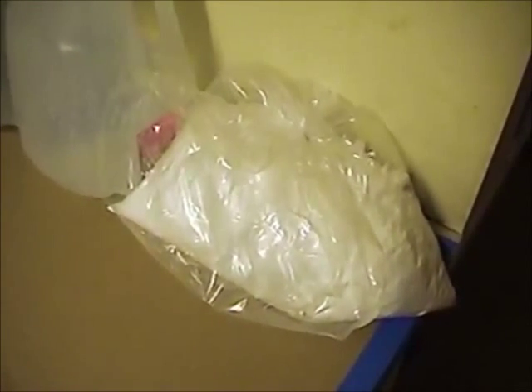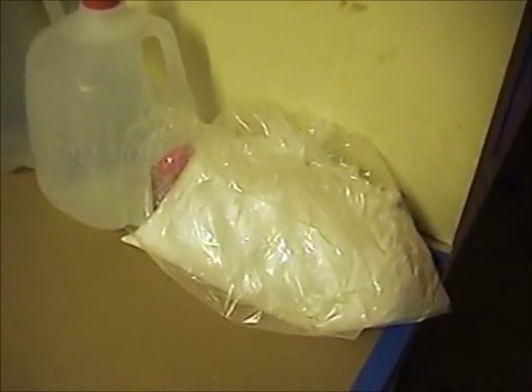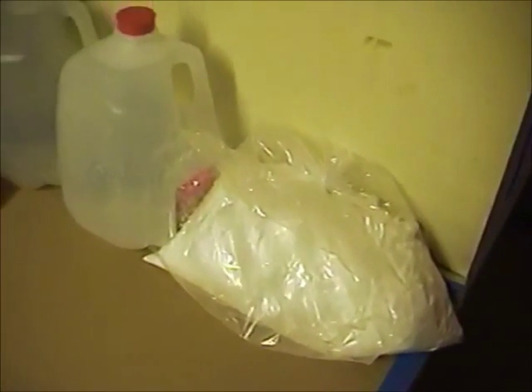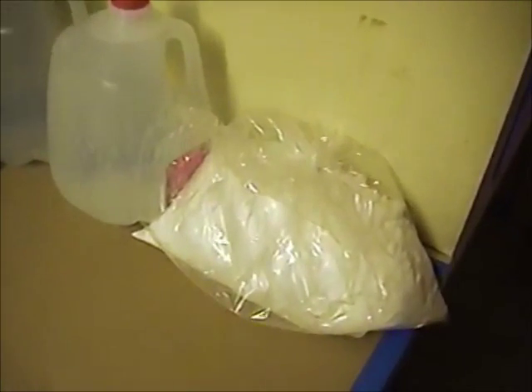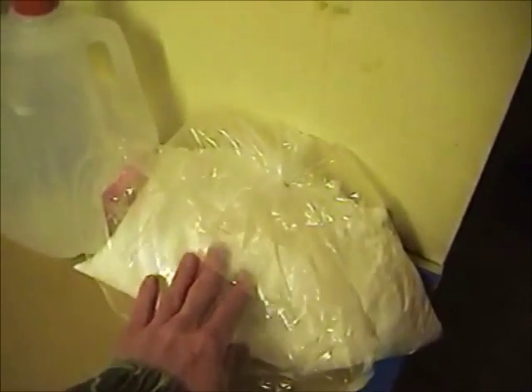There's a process that occurs whenever crystals form from a solution called nucleation. During nucleation, the first thing formed is one atom of something; more atoms attach to that atom and create a complex crystal known as a precipitate. According to the literature I've read, these crystals come down as a coarse, fine sand granule, which is easy to wash.